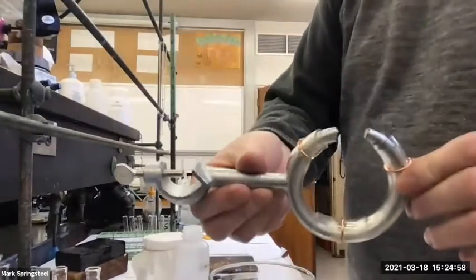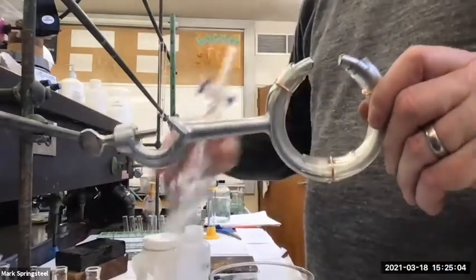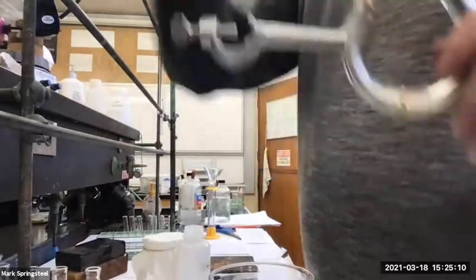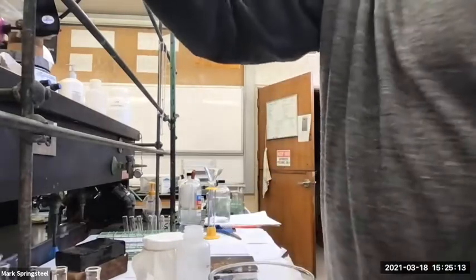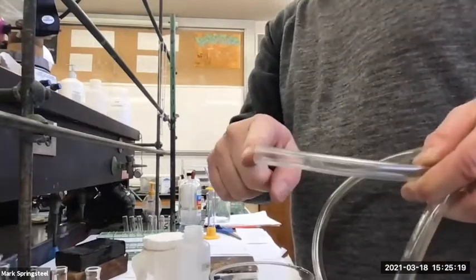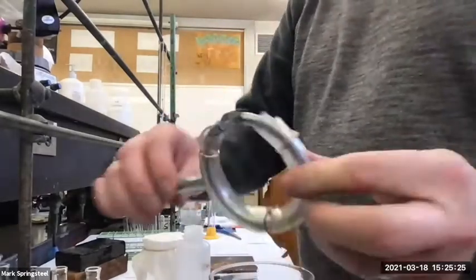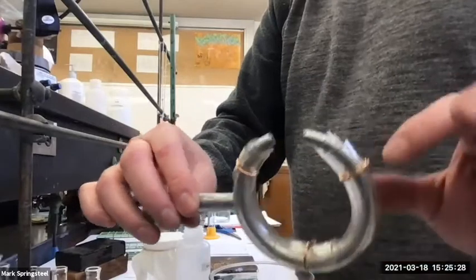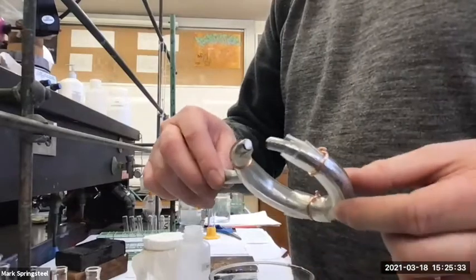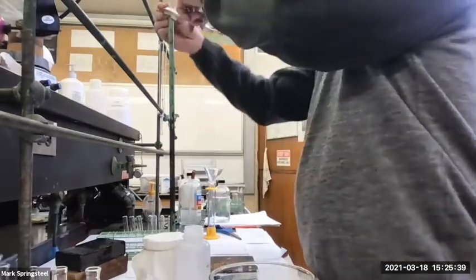And I have an iron ring. The iron ring was a little bit too big. This separatory funnel would slide through it. It wouldn't hold it. So I cut some rubber hosing in half, like rubber hosing like this. I took a razor blade and I cut along the side of it so it can open up. And then I just wrapped it around the metal ring. And then I took some copper wire and I just crimped it down to hold it all. So now it's a softer thing to hold the glass, and also the diameter is smaller, so it'll hold it. It won't fall through.